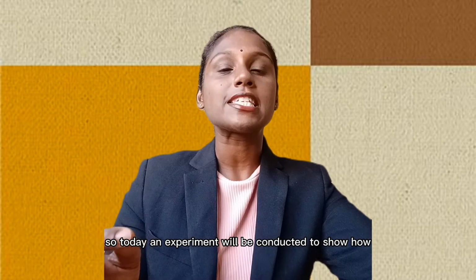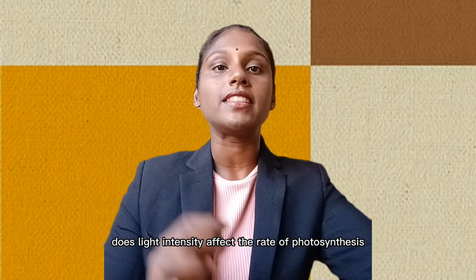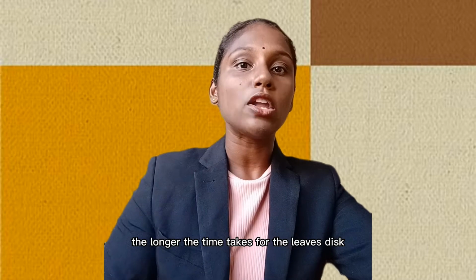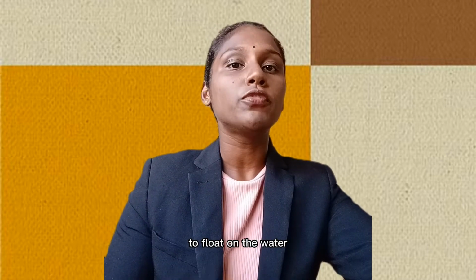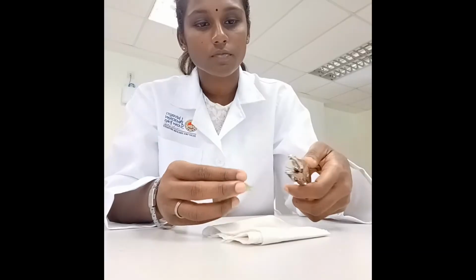So today, an experiment will be conducted to show how light intensity affects the rate of photosynthesis. The hypothesis of the experiment is the further the light moves from the plant, the longer the time taken for the leaf discs to float on the water. These are the materials needed for the experiment.